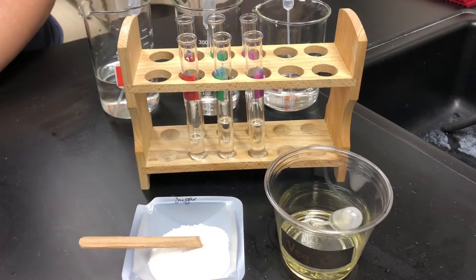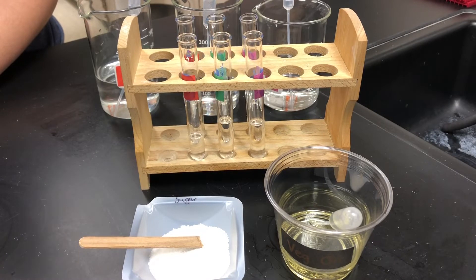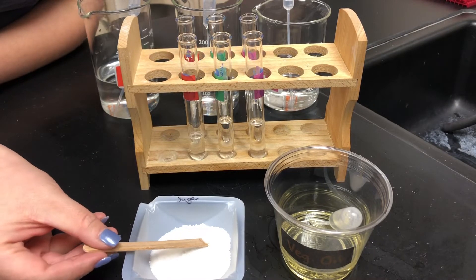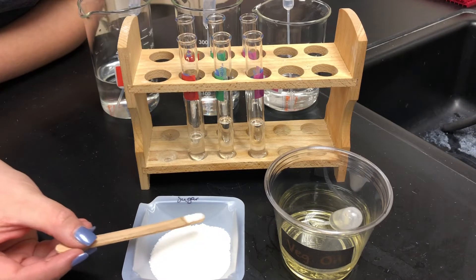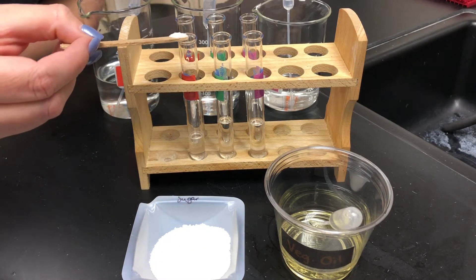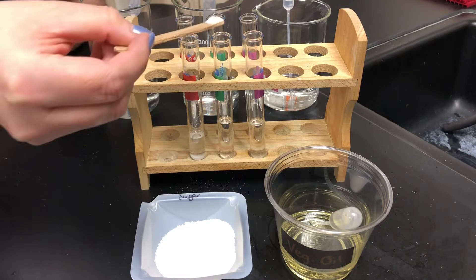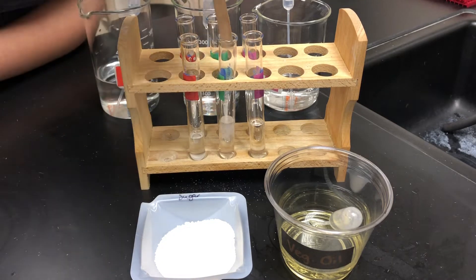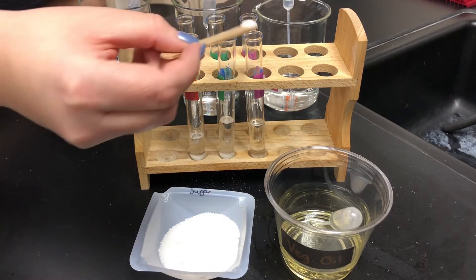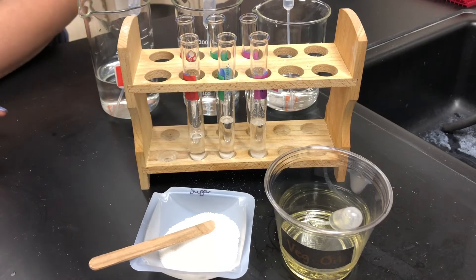We will now perform the solubility test. First we will start with a small amount of sugar and place that into each of the test tubes. We will then shake the test tubes for approximately 30 seconds and observe if sugar is soluble in the solutions.